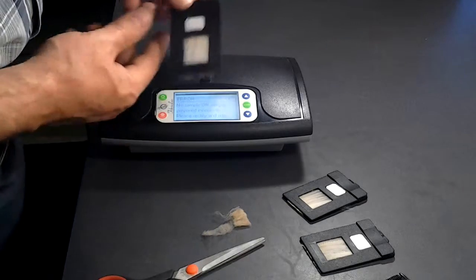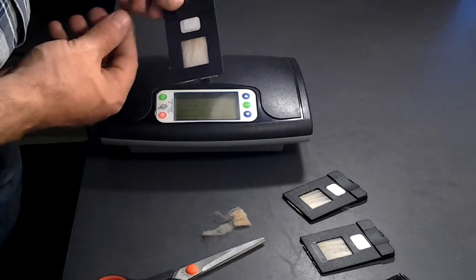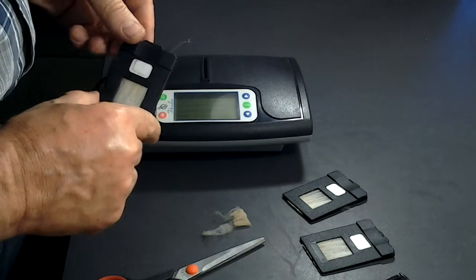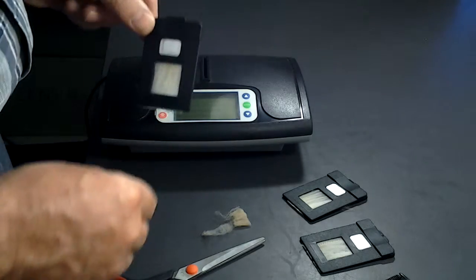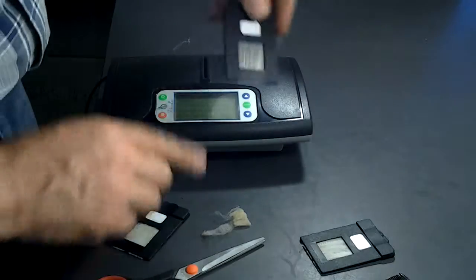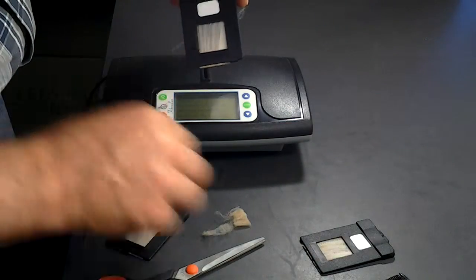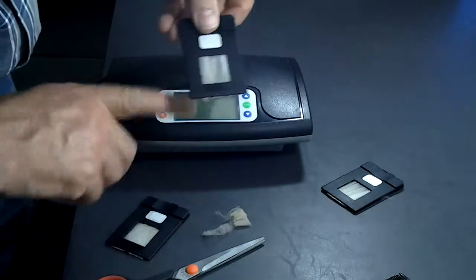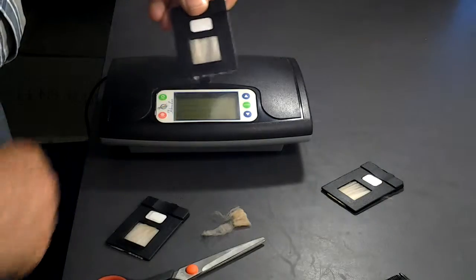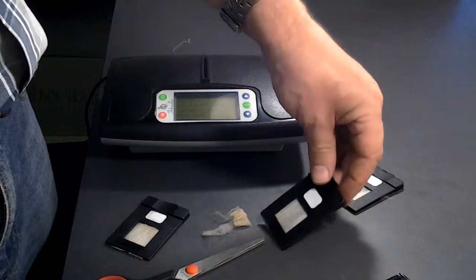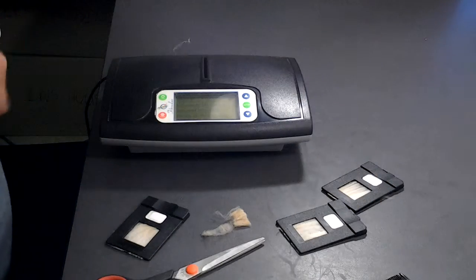If you look at this one, you can't really see through it. It works on the light principle. So if the light can't shine through, you can't get a measurement. On these, you can see through. For consistency, please try to get your samples to the same density every time.